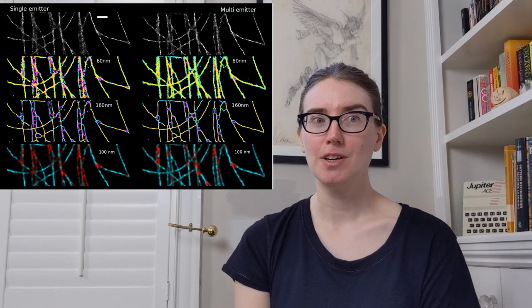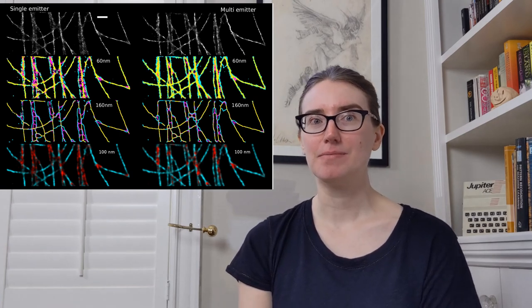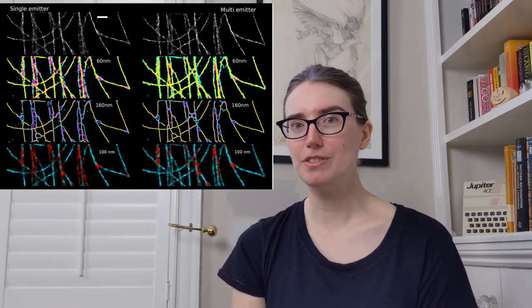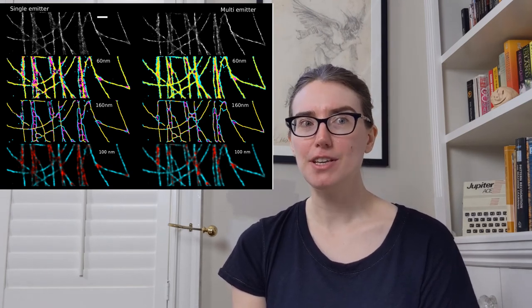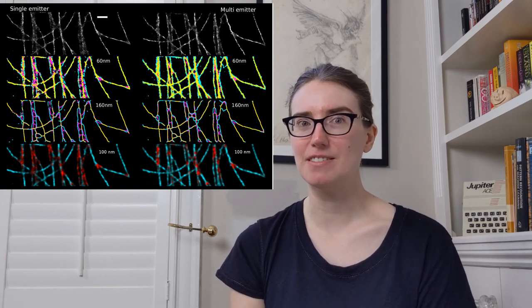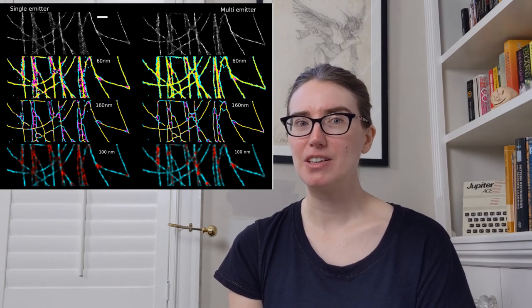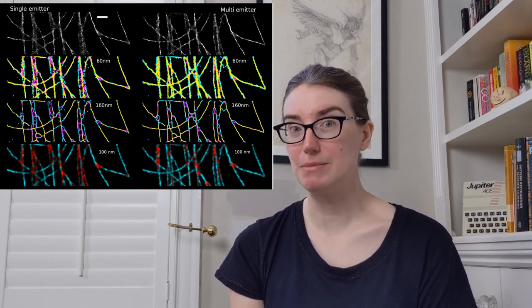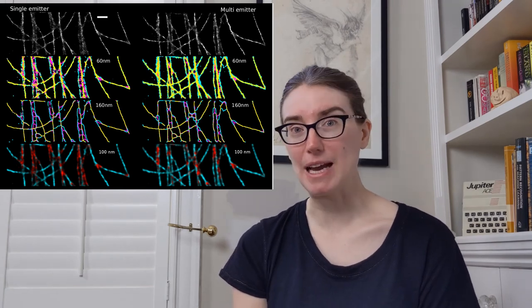We tested HawkMAN on data from the localization microscopy challenge of microtubules, where it was able to identify areas that didn't have an accurate structure. Here I fitted the data with two different algorithms, a single emitter and a multi-emitter fit. Below the images, I show the sharpening map, structure map, and confidence map for a particular length scale. As you can see, for the single emitter fitting data, the sharpening map identifies many areas of sharpening in magenta. These are much less apparent in the multi-emitter fit, as we would expect.